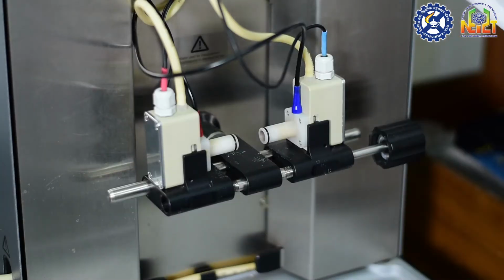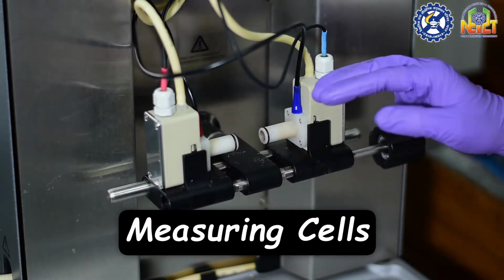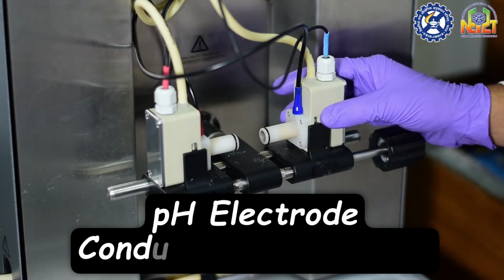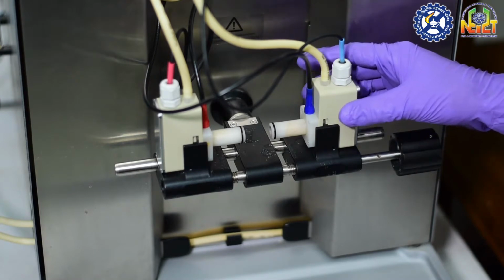Here in this surface electrokinetic analyzer, we have different parts. First, we have two measuring cells, which are connected to two different electrodes. One is a pH electrode and one is a conductivity electrode. These measuring cells can be mounted to this measuring cell holder.